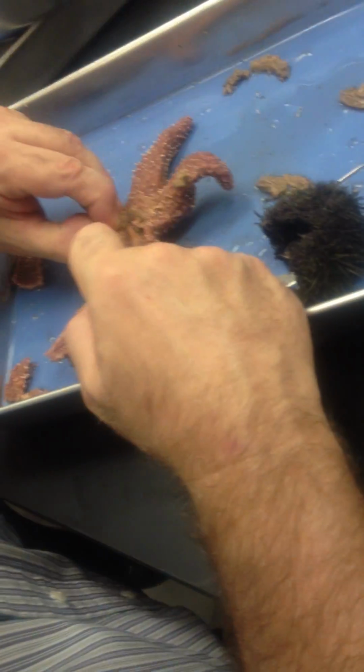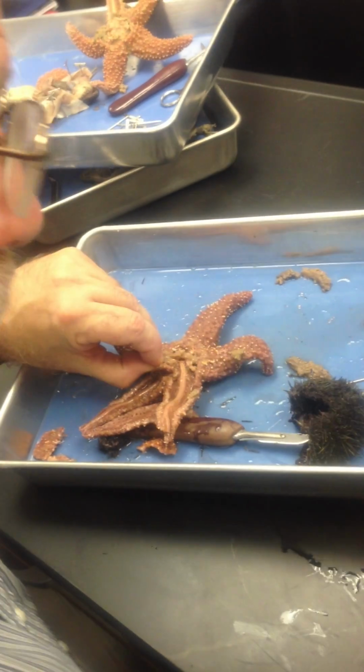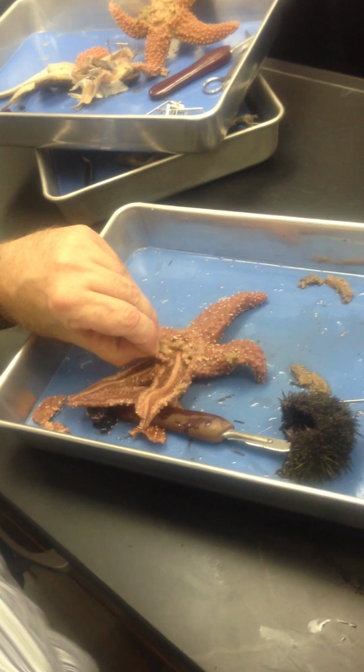I think that's it. By George. Well, no, that's gonad. Hang on. Let's see what we can do here.